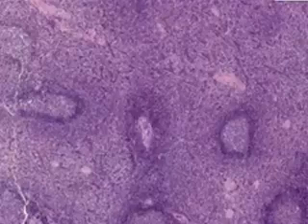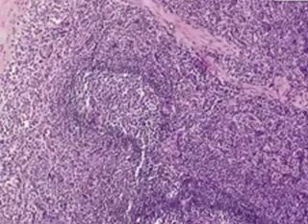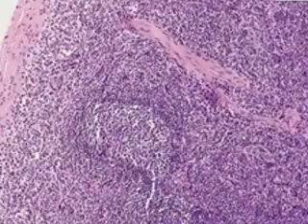Let's identify a few more classical areas in the spleen. We've already seen the nice fibrous capsule. We could see that there are also extensions of fibrous tissue within the spleen, which are called trabeculae, which look very much like the capsule in that they have spindly cells, predominantly fibroblasts, as well as collagen, just like what you see here in the spleen. Here is a secondary follicle with a germinal center on the inside. And here is the area of red pulp, which is predominantly sinusoids.